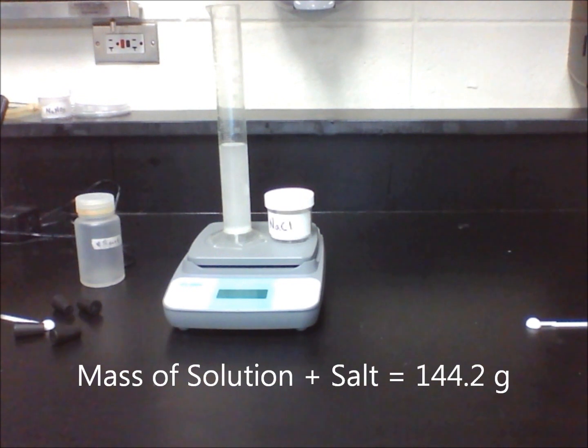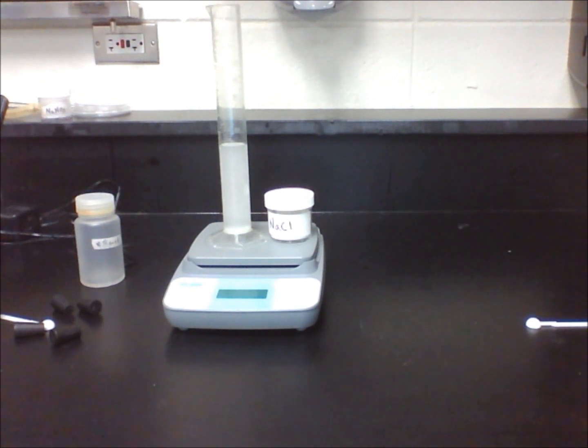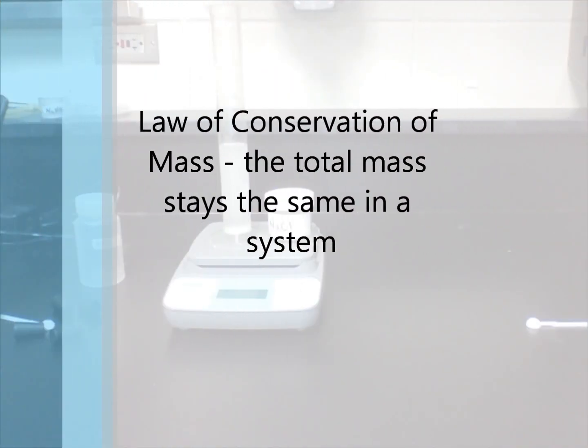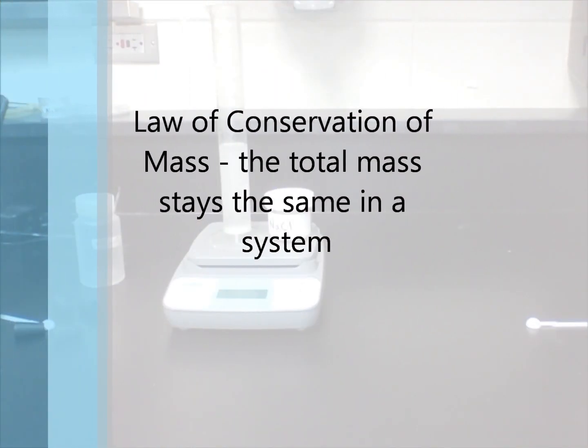You should find that this lab also demonstrates the law of conservation of mass by showing the mass before and after the solution was made stays the same because even though the substances were mixed differently, no actual material was lost or gained in the process.